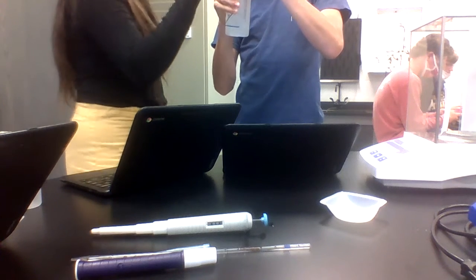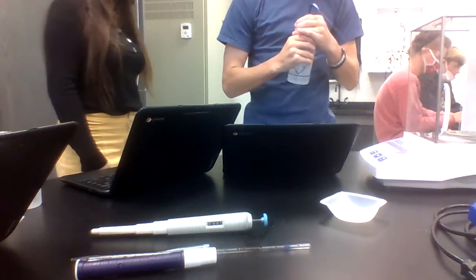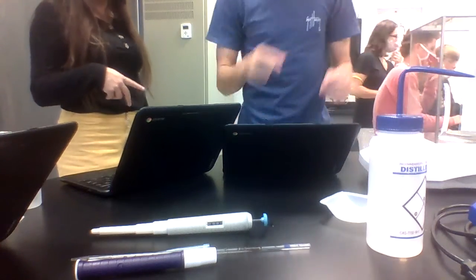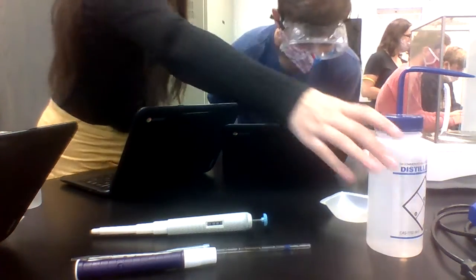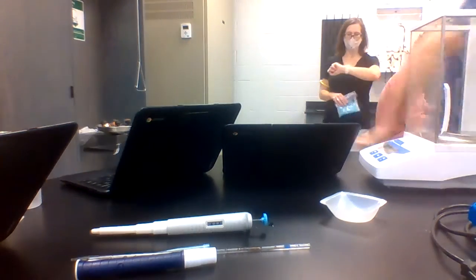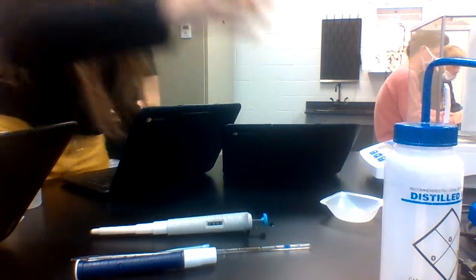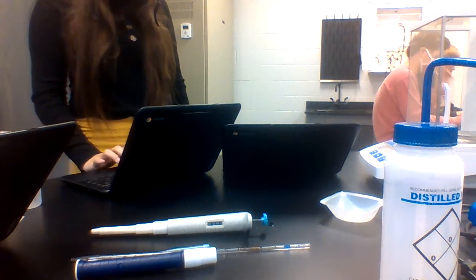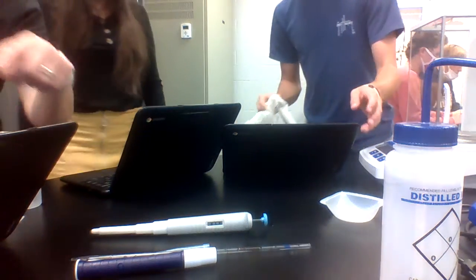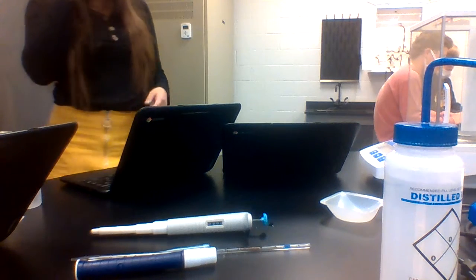Would the mass row be grams or milliliters? I put it as grams. This one's milliliters. When we got the decimal place, I put it in as grams. What are we supposed to do with this? Temperature. Do we do this part now? Oh, you do need to take the temperature of your water, so just put the thermometer in there and leave it for a minute or two and then read it.